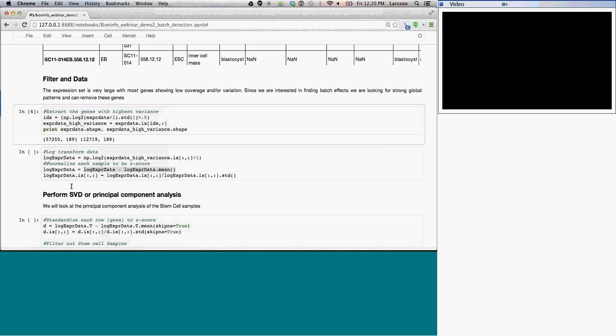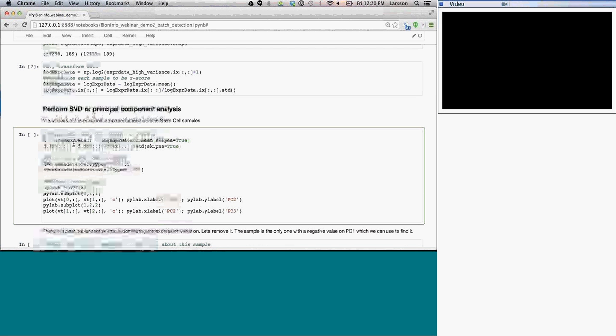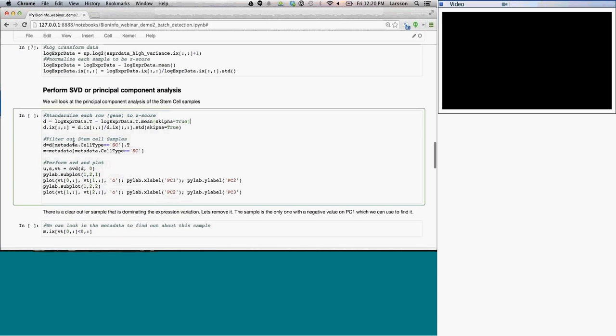And again here, with the new high variance data, I'm doing a log transform, and then I'm going to normalize each sample. I'm doing the log transform since they're FPKM, which are always going to be positive numbers. And I'm mean centering them basically so the variance is around 0, and then I'm also dividing by the standard deviation to basically turn these into z-scores, so that each gene is now represented by a z-score. This is just to make it so that the statistics underlying the singular value decomposition become more similar to a PCA.